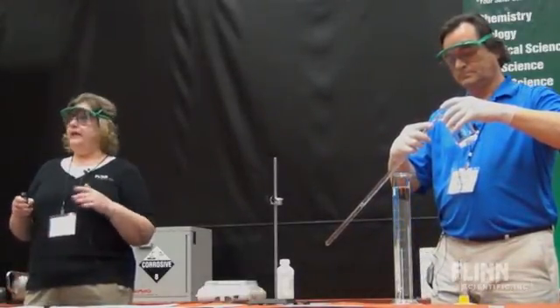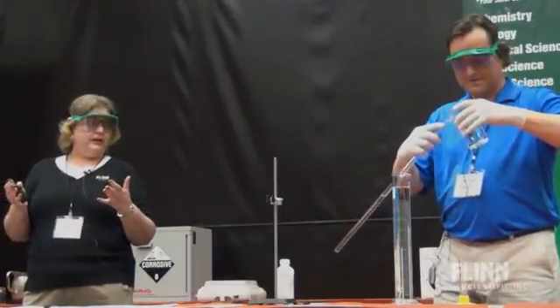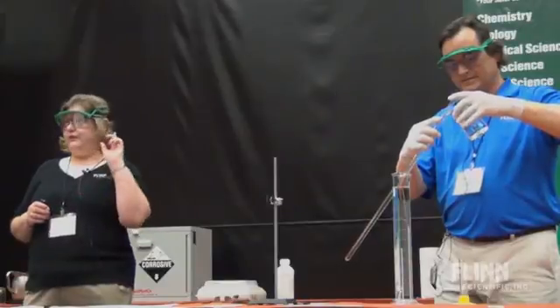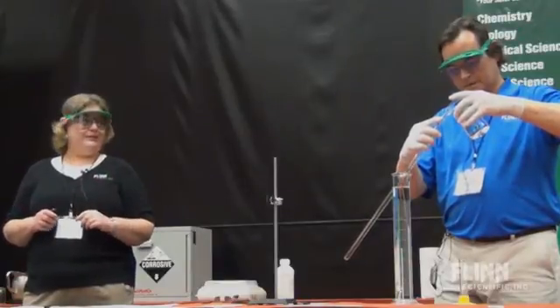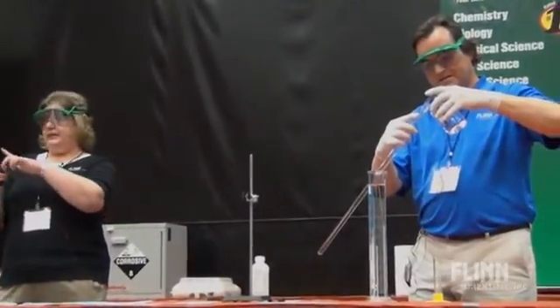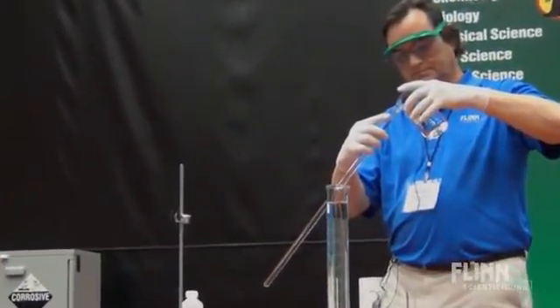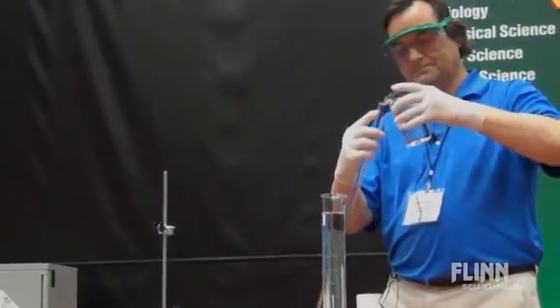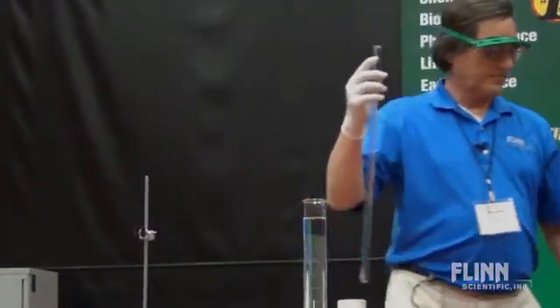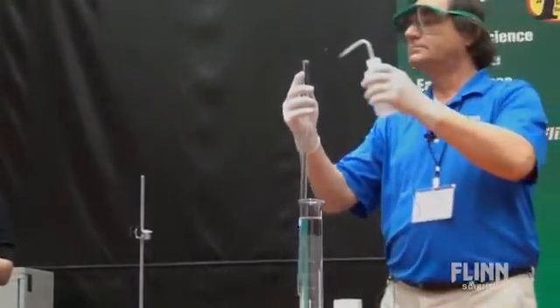What Scott did first of all was he added a pre-measured amount of 3 molar HCl to that gas measuring tube, and now he's going to fill it all the way to the very tippy top with water, without mixing yet, because he's carefully poured it down the side.